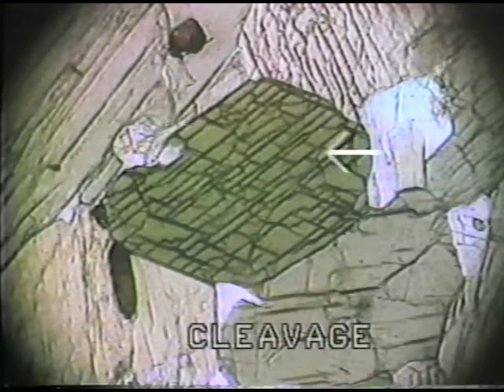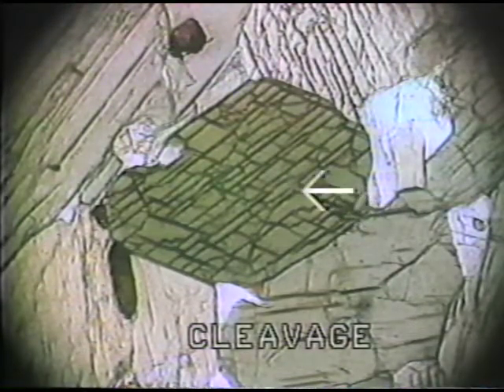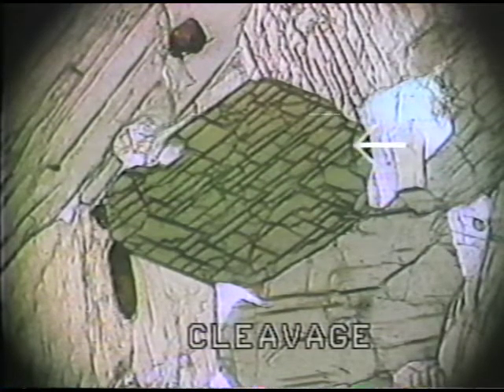Now, the hornblende is not an isotropic mineral, but it allows us to look at a very good example of cleavage within a particular mineral. And here I'm pointing out the very well-developed cleavage forms within these amphibole grains. And you can see that this particular mineral, the amphibole, makes about a 60-degree, 120-degree intersection within two prismatic cleavage forms within the crystal. And this is a very useful parameter for its identification.